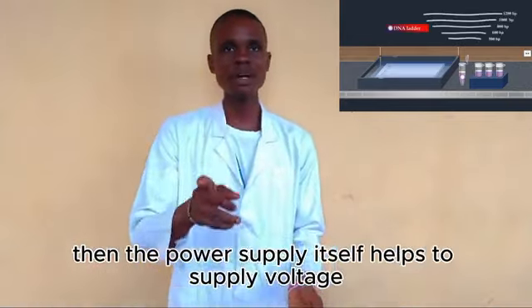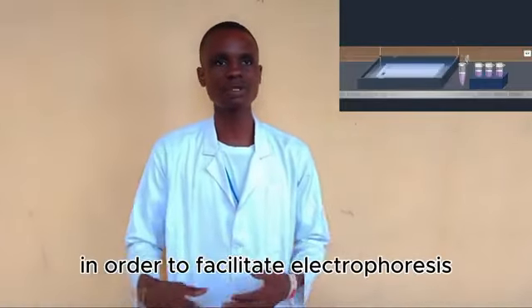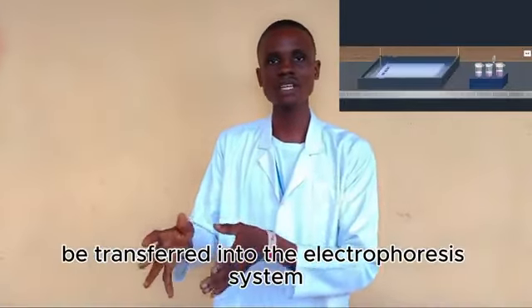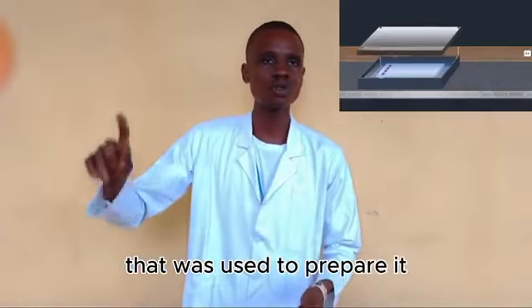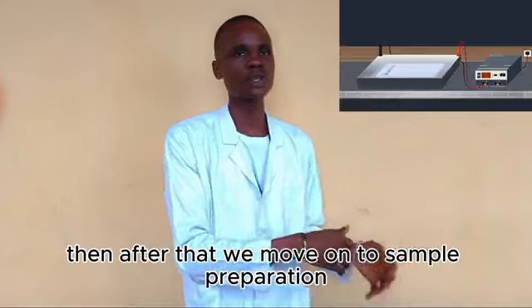The power supply supplies voltage in order to facilitate electrophoresis. The gel tray is then placed into the electrophoresis tank and covered with the buffer that was used to prepare it. Then we move on to sample preparation.